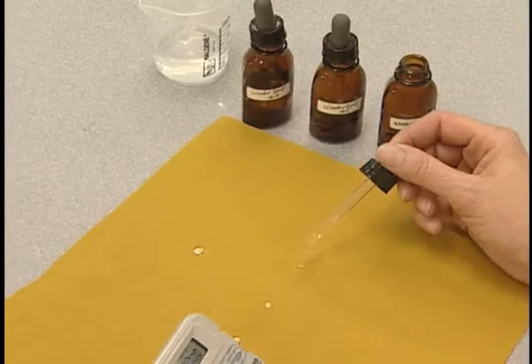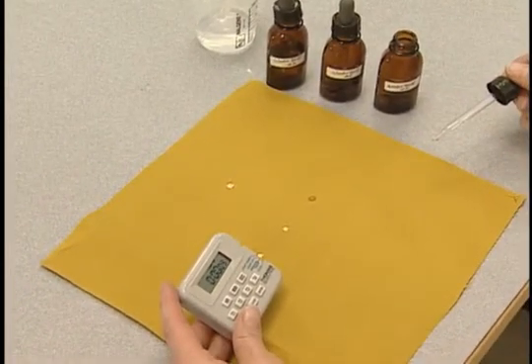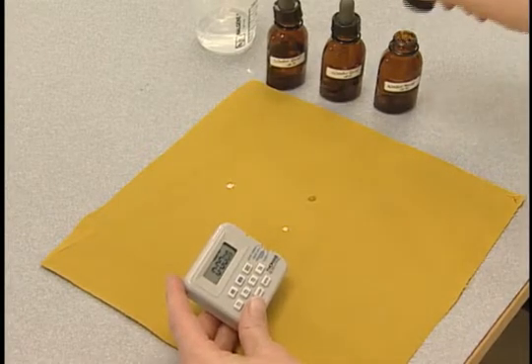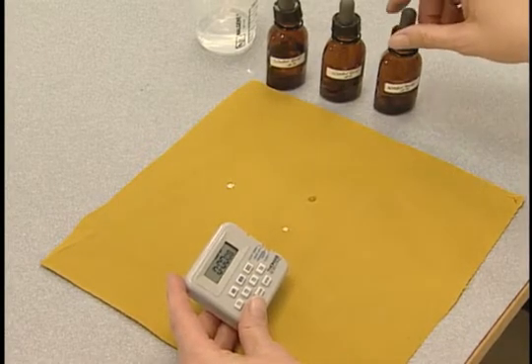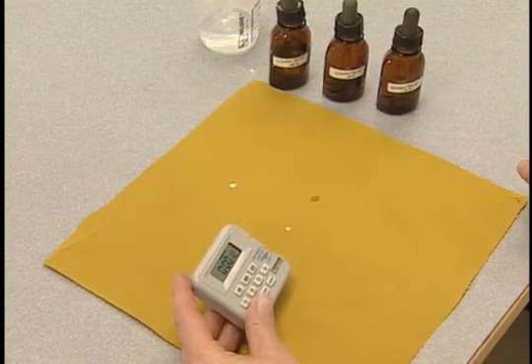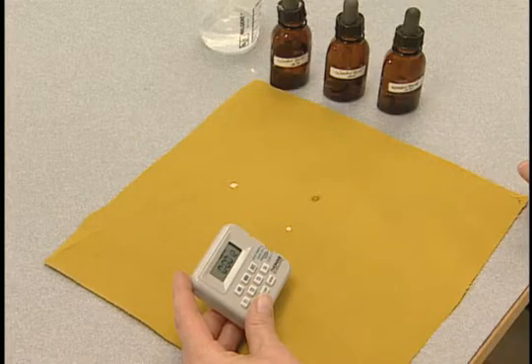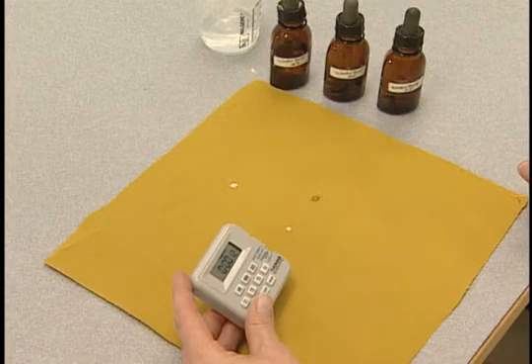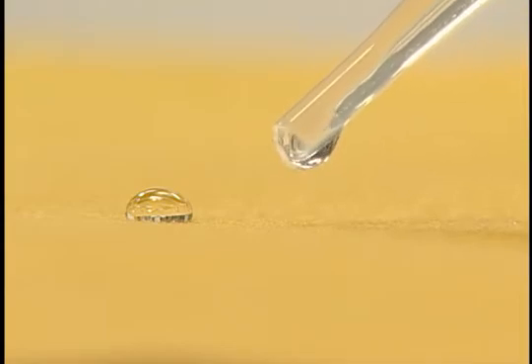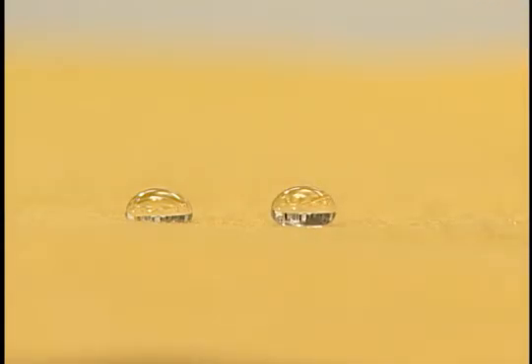Basically, using one test liquid at a time, a drop of the lowest numbered test liquid is applied in five locations on the fabric, which has been placed flat on top of standard blotter paper. The drop locations along the width of the fabric specimen are to be at least four centimeters apart to prevent contaminating a test site. The test also prescribes that the end of the dropper be approximately 0.6 centimeters above the fabric surface.